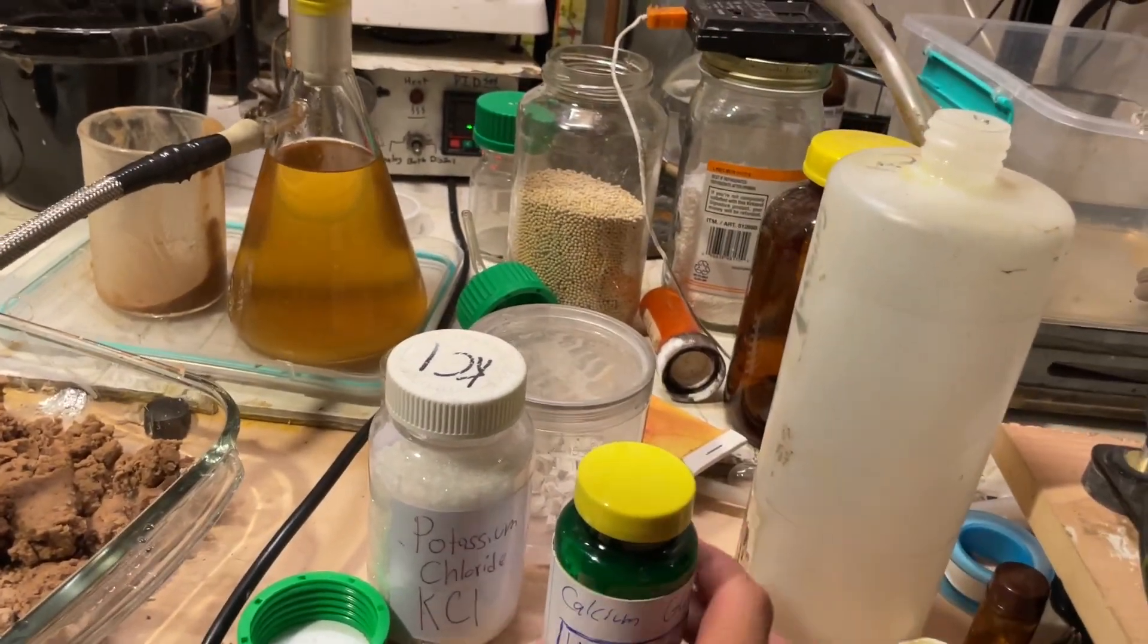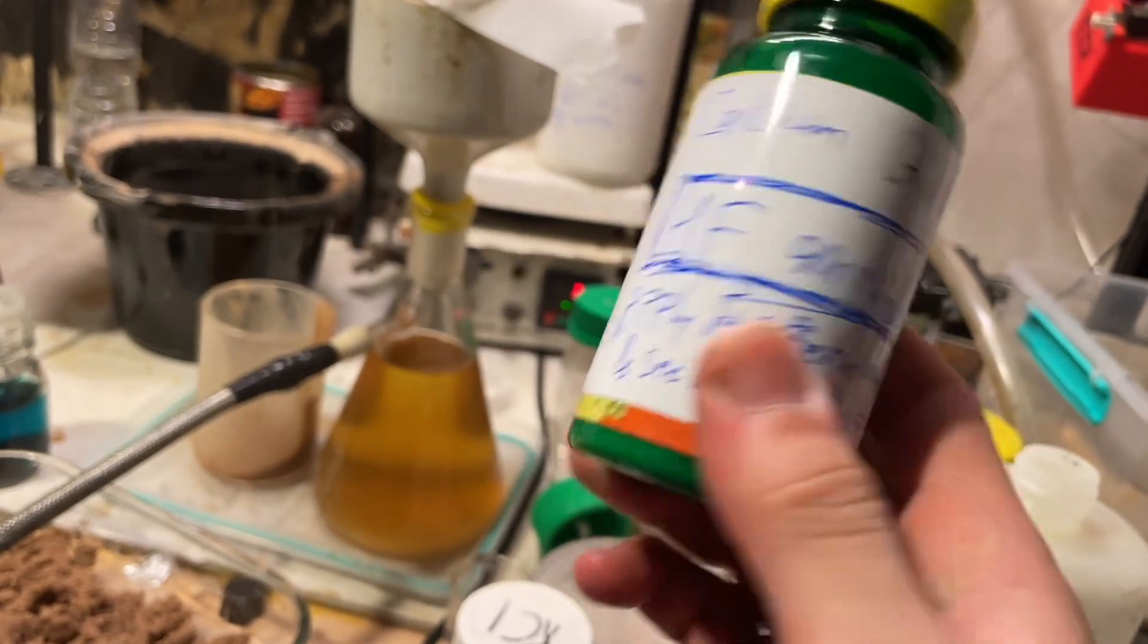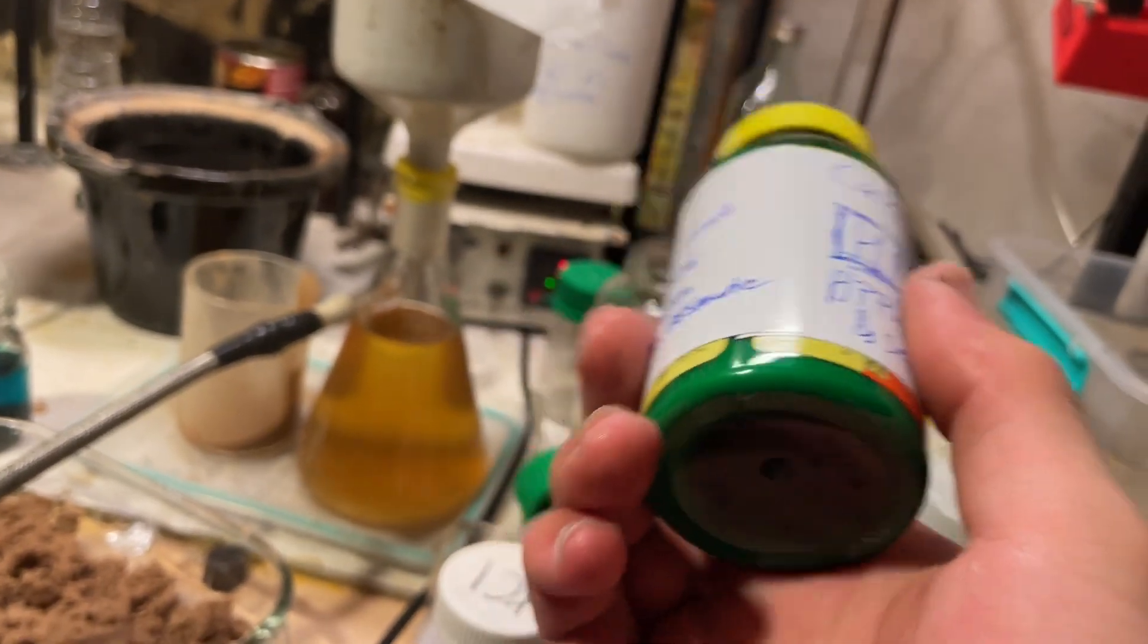So this is a quick second channel video, because it's not really worth making a full video about. Here's some calcium gluconate gel I just prepared for use with HF.